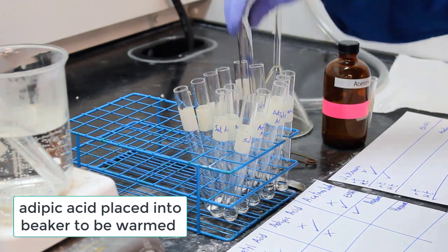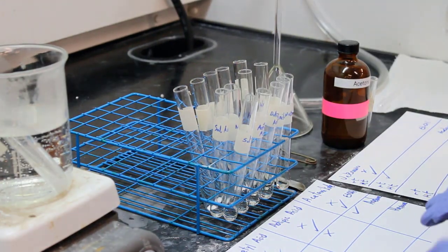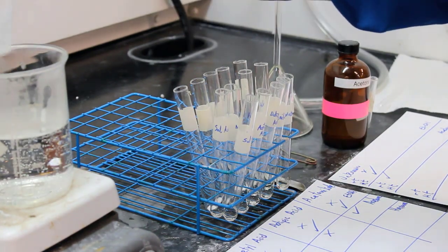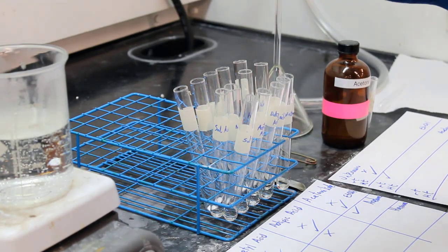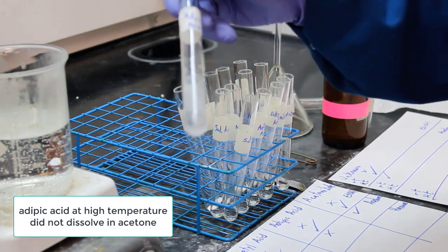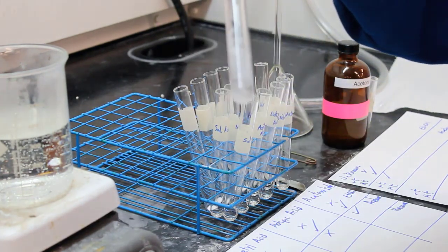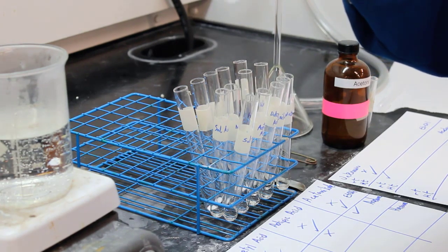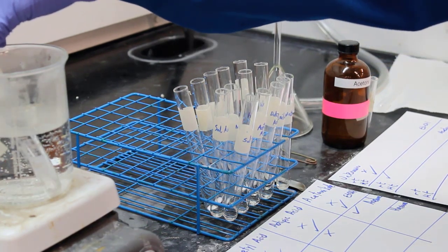All right, and then of course they didn't check the salicylic acid at high temperature because it had dissolved at room temperature. So, all right, adipic acid in acetone at high temperature does not dissolve, and that's because it didn't dissolve at room temperature.